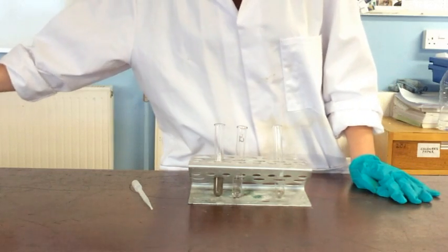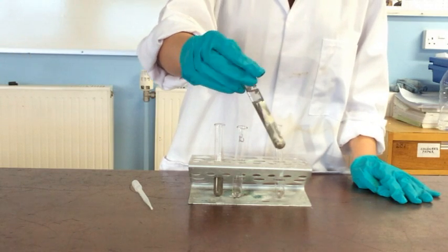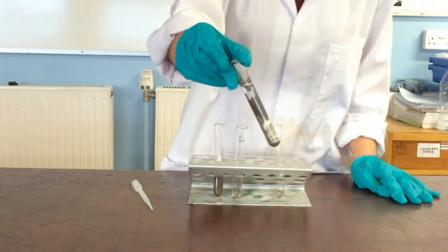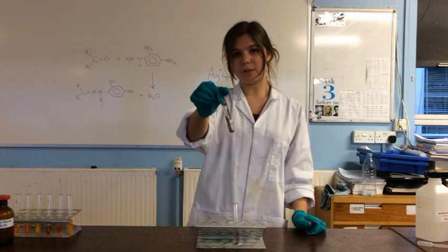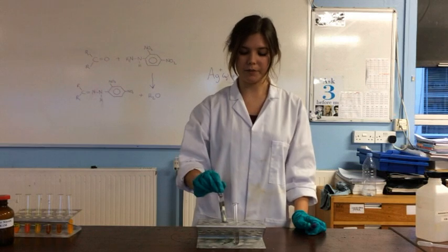Here's one I made earlier which went much better and you can see the silver mirror effect that we were looking for. Looking now at the formation of this precipitate, it's actually just silver.